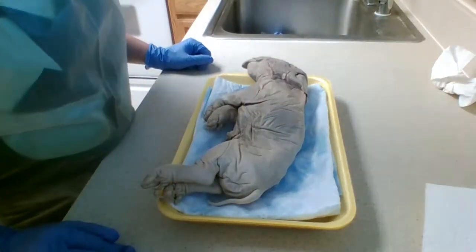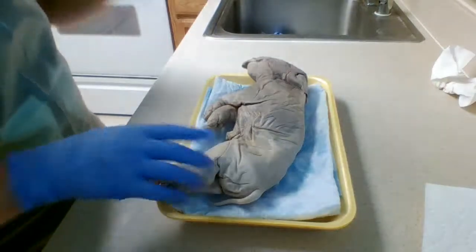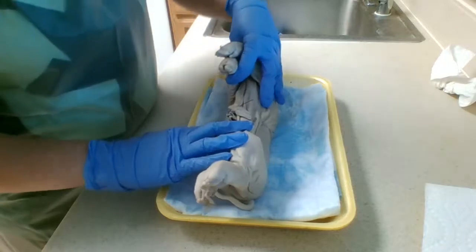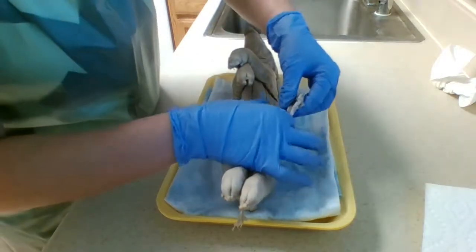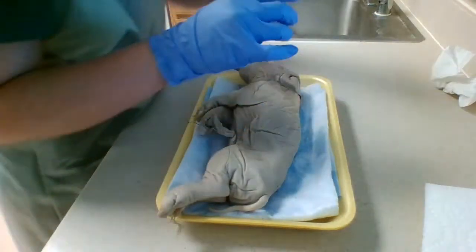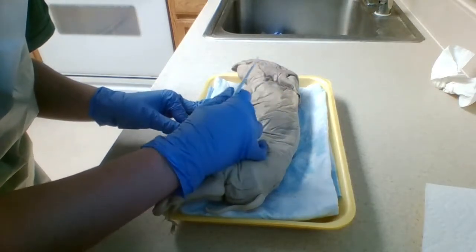Okay, so now we're going to put the pig on its back, which is also known as its dorsal surface, and we're going to examine its abdomen. Here we have its umbilical cord that is now tied. In the video, it showed that if it is tied like this, we want to make a small cut so that we're able to see the umbilical vein and arteries. So I'm going to do that here with the scalpel provided by the kit. I already uncapped it, and I'm going to pull it away.